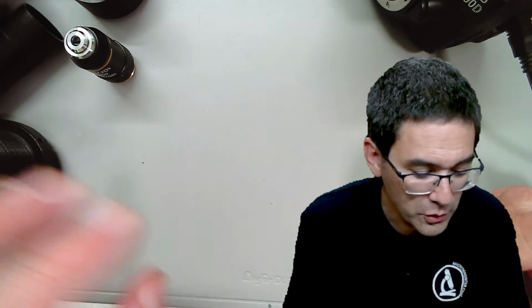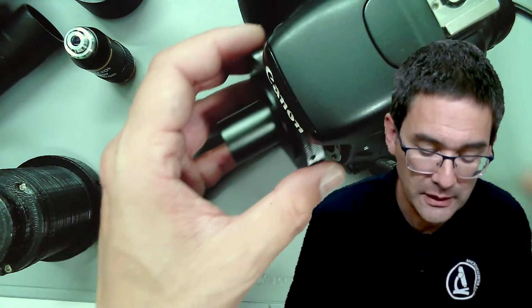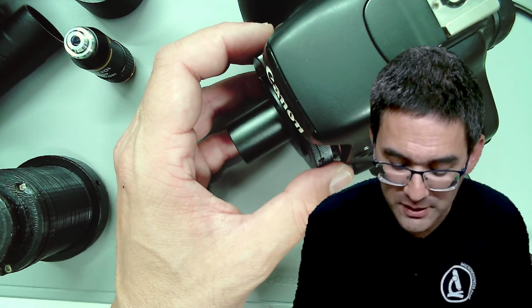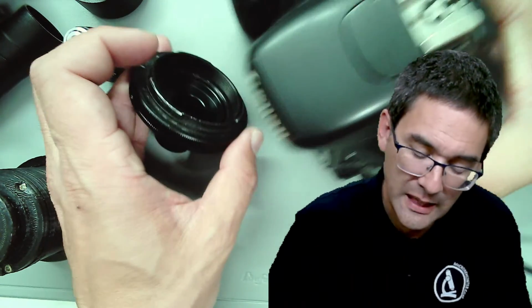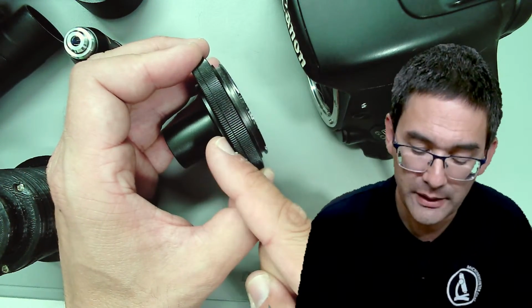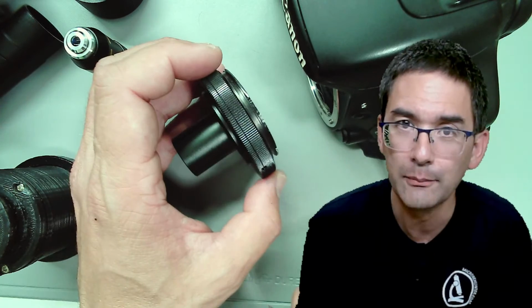Okay, so I just want to show you now something quite interesting. I also made a separate video on this. It's about this direct projection, because as I told you already, this one over here is used for the DSLR camera direct projection. But you remember the whole thing with the focus. So wouldn't it be kind of nice to move the camera close enough to the microscope and design your own adapter so that it's directly projected into the camera?